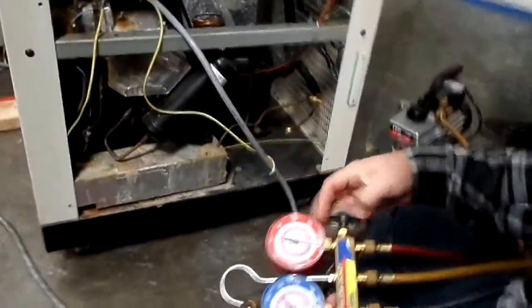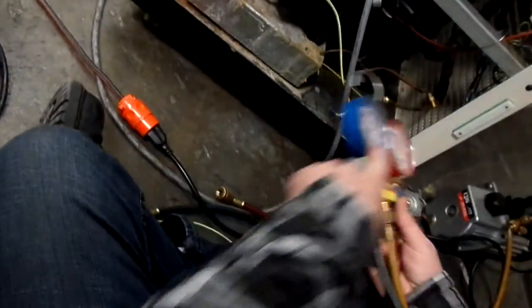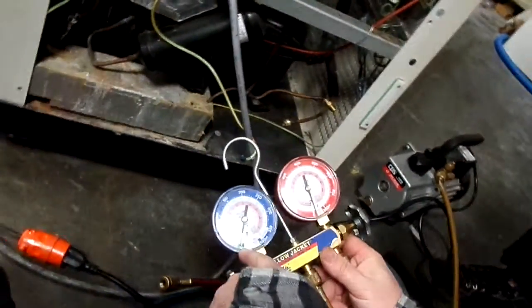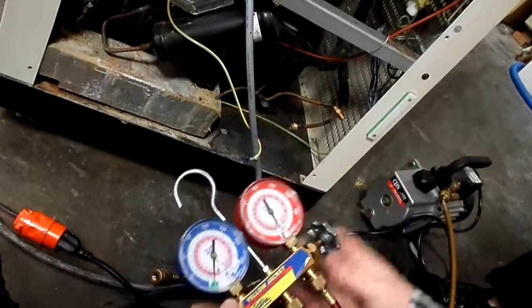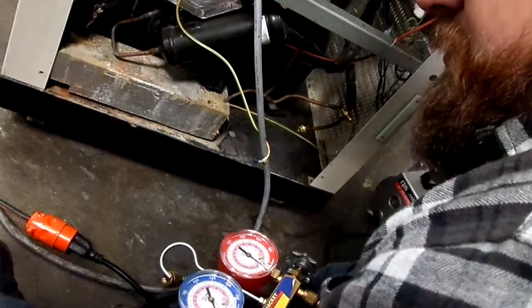We'll go ahead and pull vacuum for a few seconds there. You can see it's in the vacuum section of the gauges. It'll stop moving at some point. It doesn't take very long to pull vacuum inside these hoses. So close that up, turn that off, pull your hose out here.